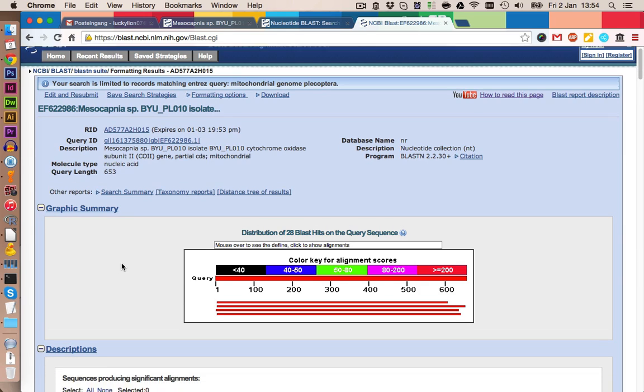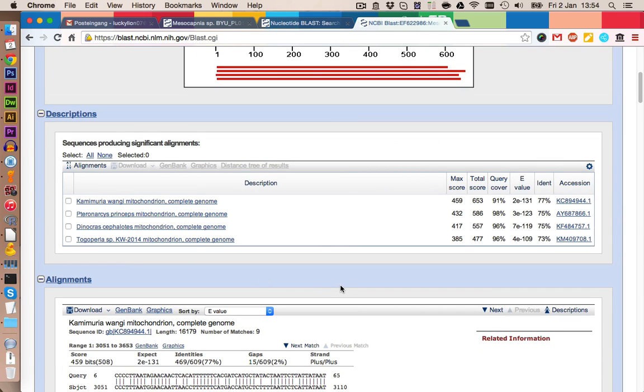Here are our results. Let's take a look into the table. And we see here that none of the sequences has a very good identity. However, the Plecoptera species here has the highest identity, so for now we're just going to pick this one and blast our hits against this reference genome. So let's go back into Geneious, and we're going to use this one as a reference genome.